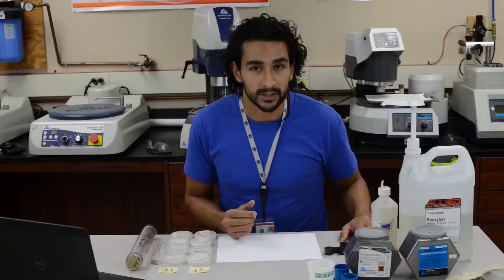Hey guys, this is the second part of the sample mounting and polishing procedure tutorial. In the second part, I will show you how to mount the samples in the longitudinal cross-section. If you haven't seen the introduction, please go and watch it — it's very important. Let's resume from where we left off last time.